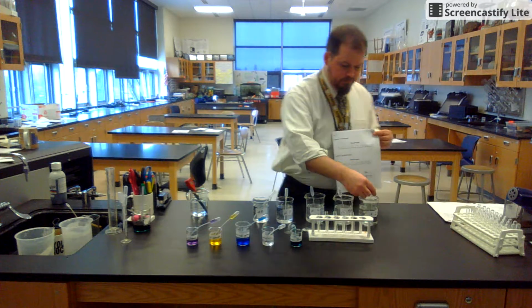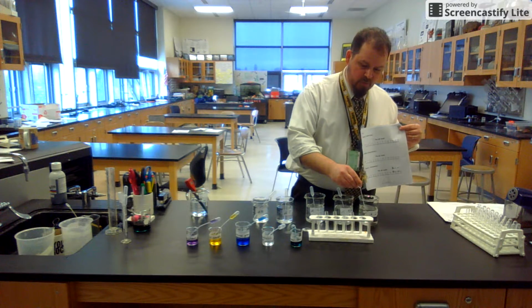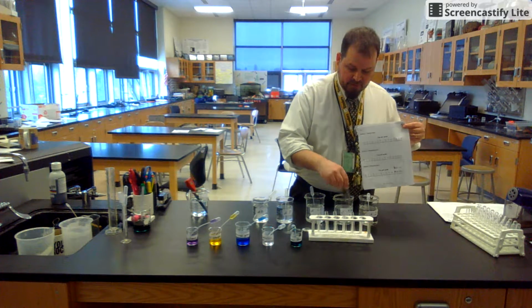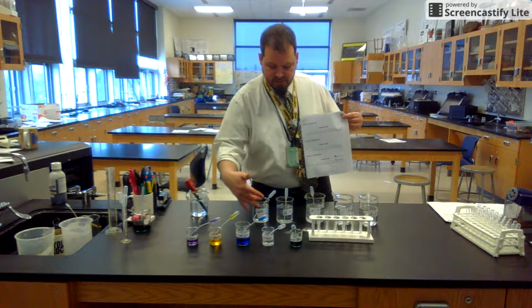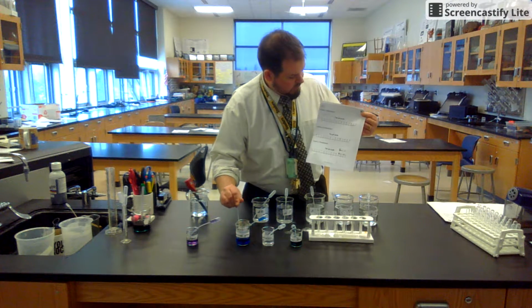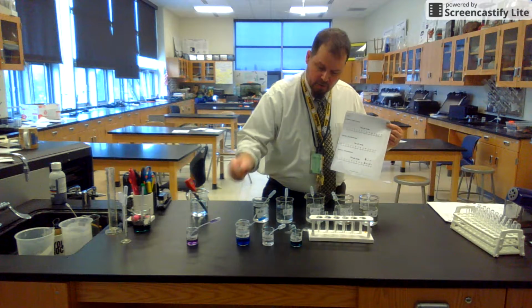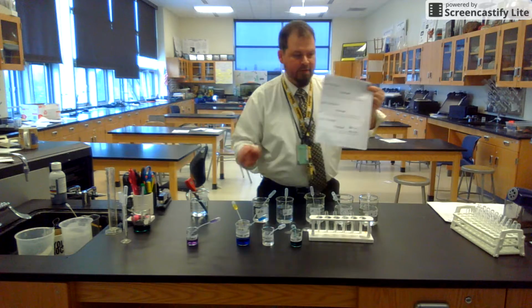So what I'm going to do is take some of pH 2 and put a squirt in the test tube. And then I'm going to take some of pH 4 and put a squirt in the next test tube. All the way down the line, 5 pH solutions, 5 different test tubes, then methyl orange. So I'm going to put 1 to 2 drops of methyl orange in each. Then I'm going to fill out my data table.